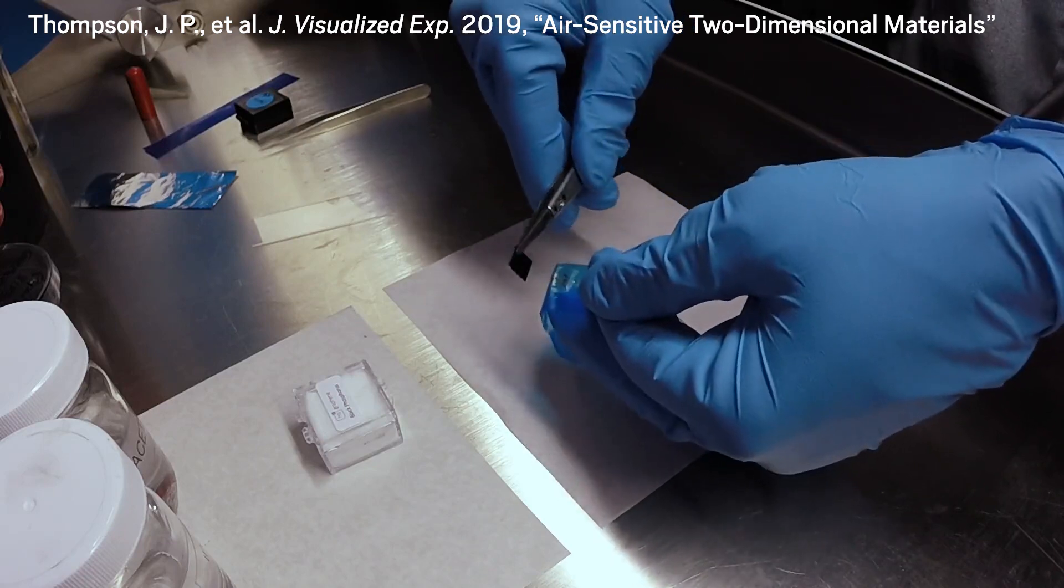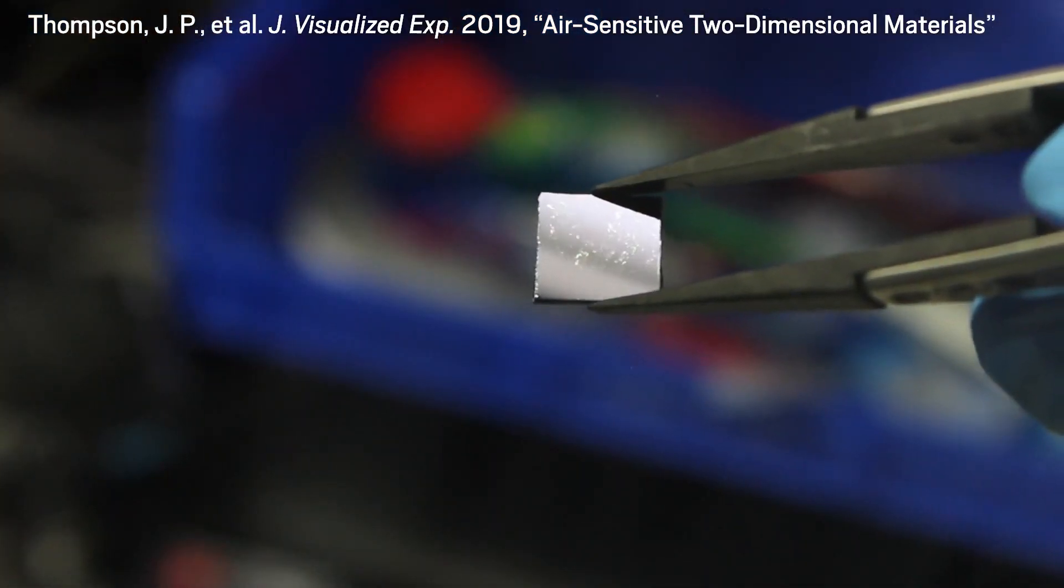When the tape is pulled away after cooling, relatively large flakes of material remain behind on the silicon chip for studying.